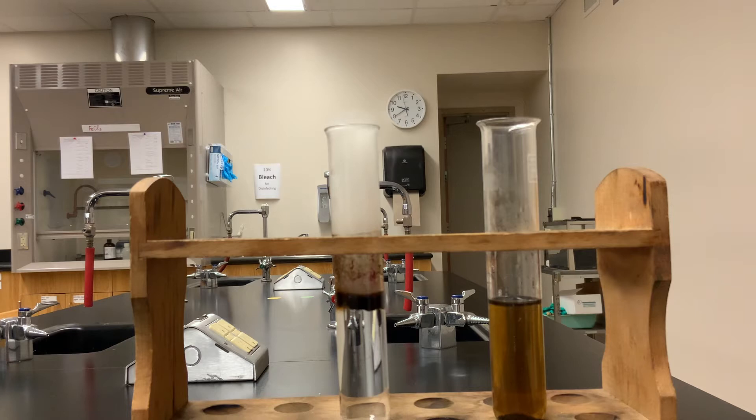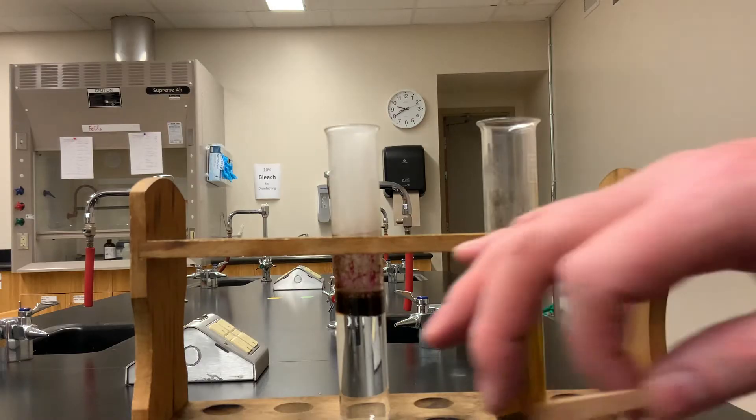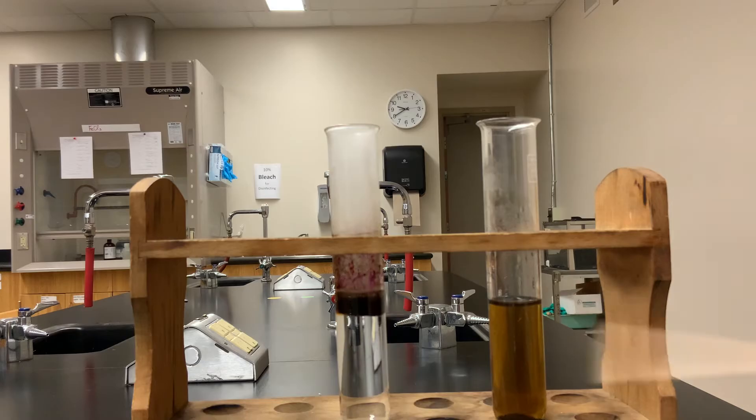Okay, so as soon as it gets added, you can see that there's a layer of brown product. Now normally when you put permanganate into water, you get a bright purple solution. Here it's formed a brown product. There's fizzing. There's a little bit of purple on the side above it.